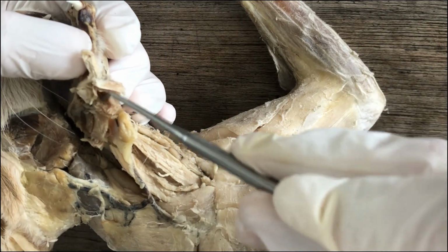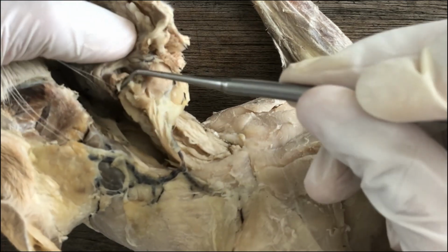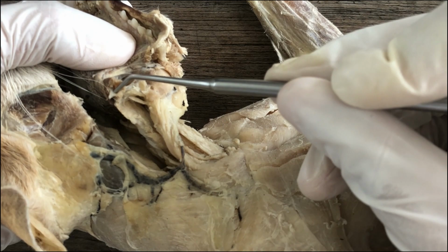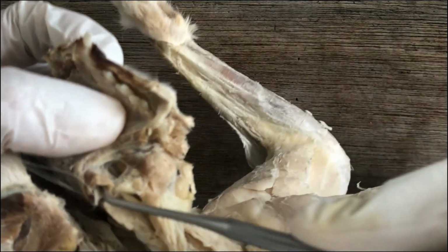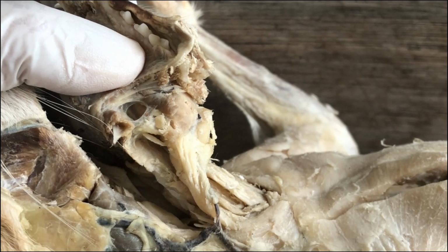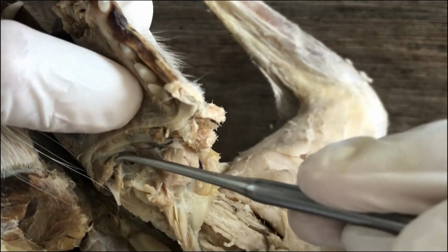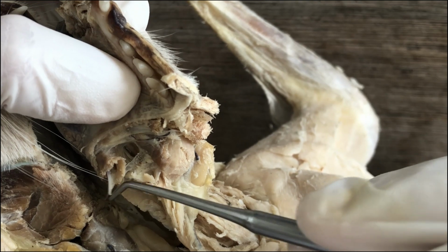One of its horns there. Let me look for it there. It's one of the horns. One of the horns peeking out.